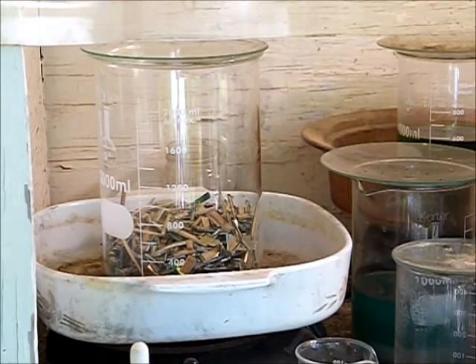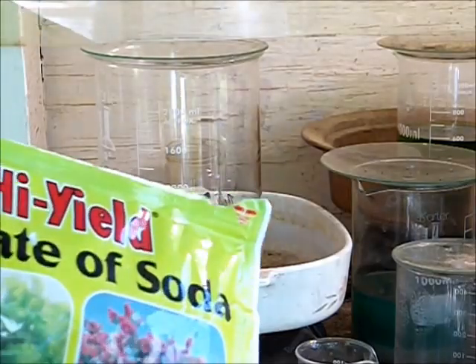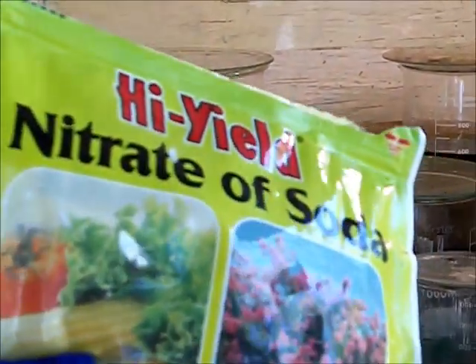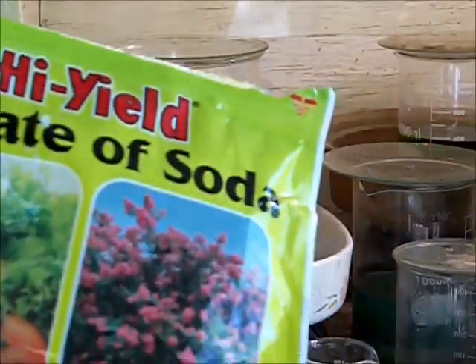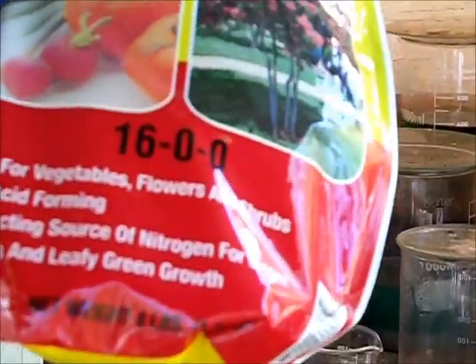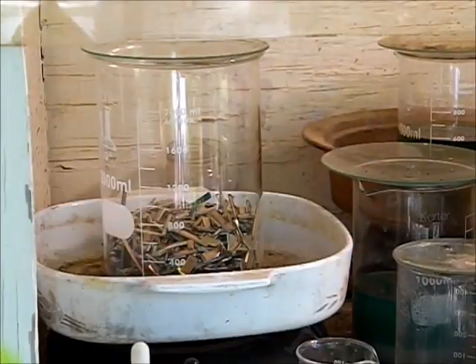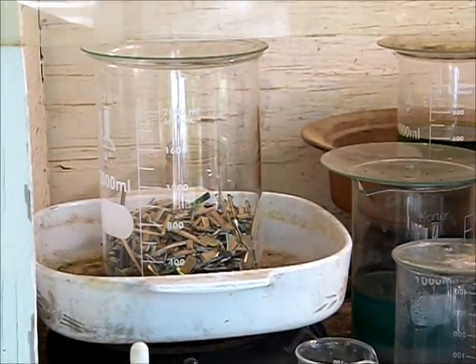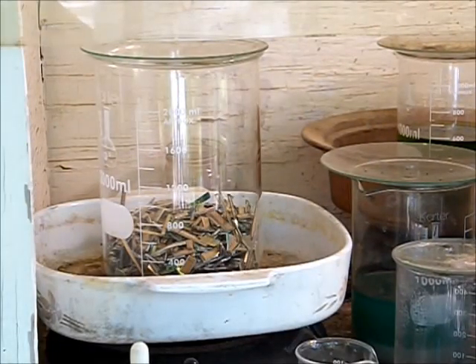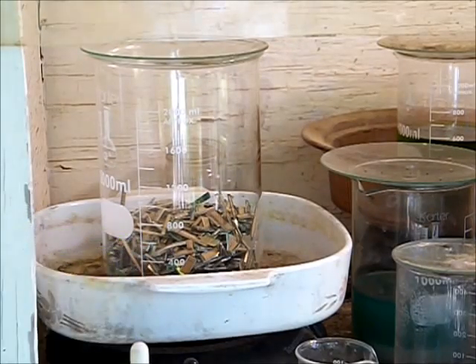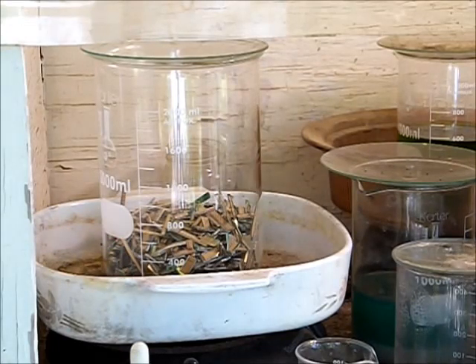For a nitrate, I use high yield brand nitrate of soda and I buy this at our local seed and feed store. It's like seven dollars for four pounds, not too bad a trade-off when you're considering the price of nitric acid.